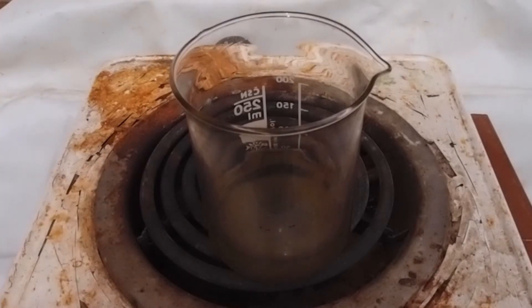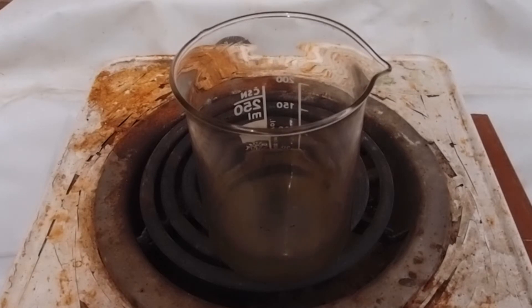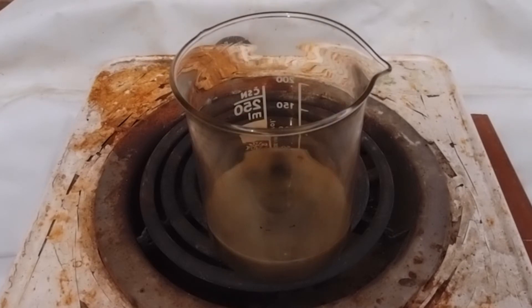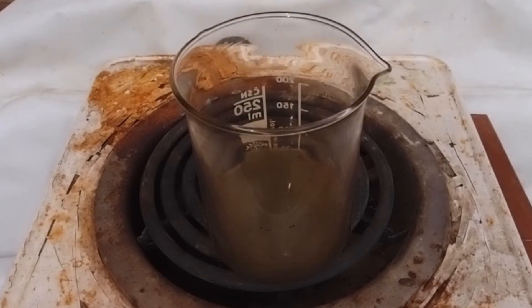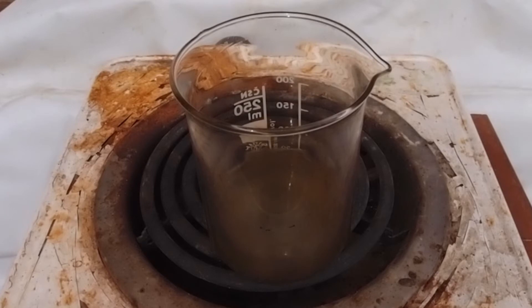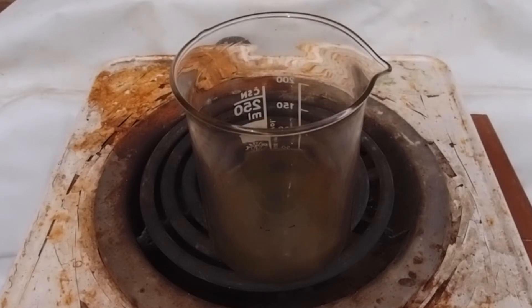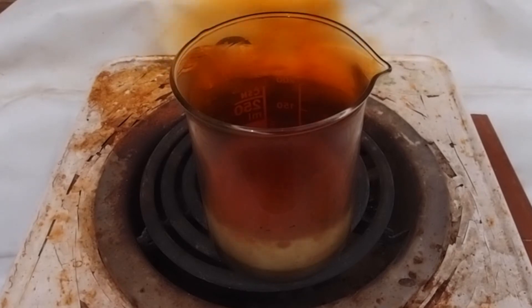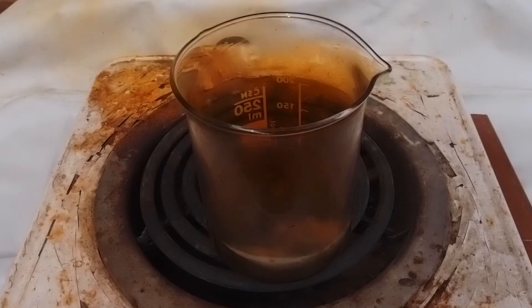The reaction proceeds on its own, but heating it a bit makes it run a lot faster. The reaction between nitric acid and iron powder produces a lot of nitrogen dioxide gas, therefore proper ventilation must be used. It can also overspill very easily, which almost happened to me, and at this point I decided to rescue my camera.